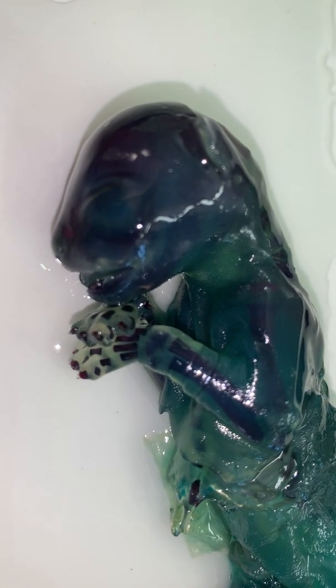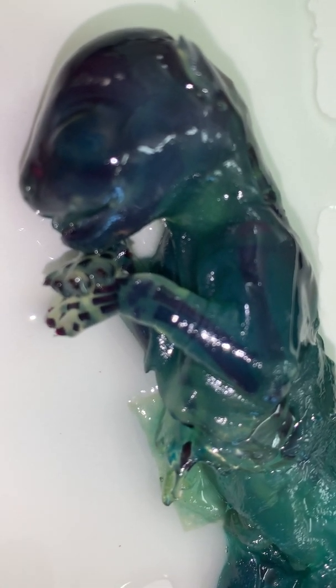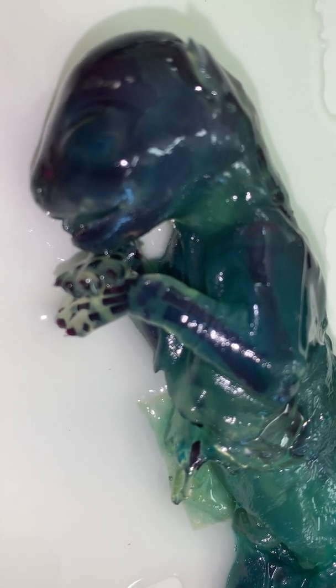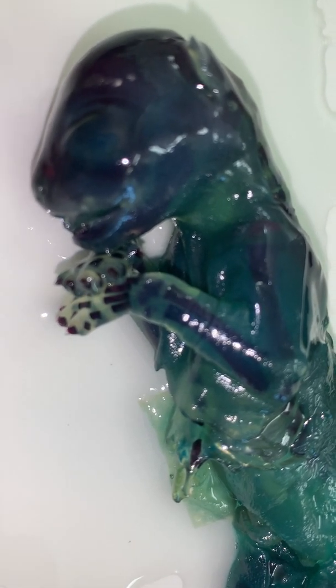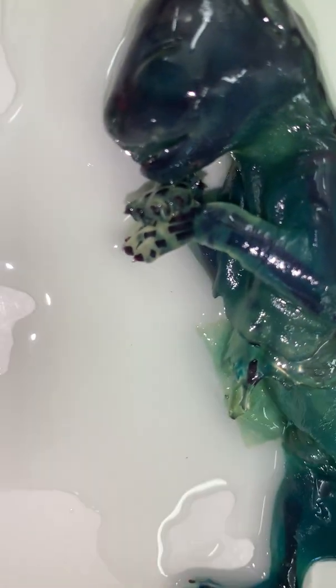All right, what you see here is a kitten specimen that has been prepared via what we call clearing and staining. It's said to be diaphanous. And what we see is that the bone has been stained red. We tried to stain the cartilage blue, but it did not pick up that stain. And then we made the flesh invisible using a pancreatic enzyme called trypsin. And so we can actually see the bones in situ.